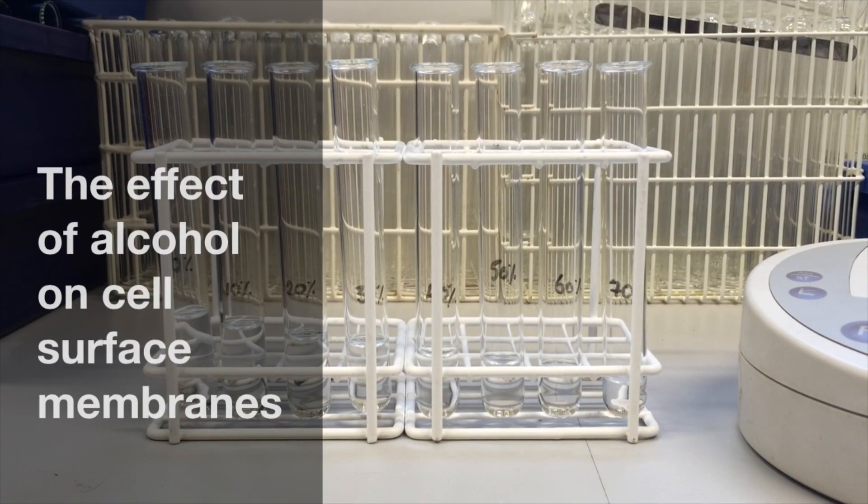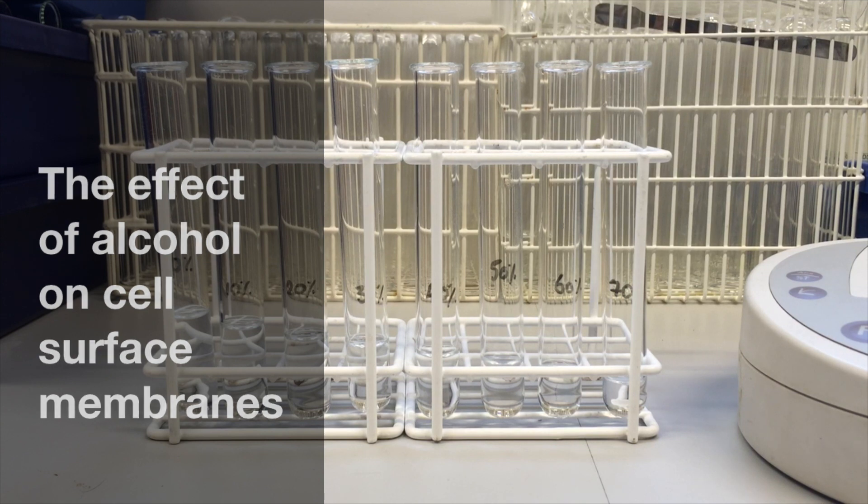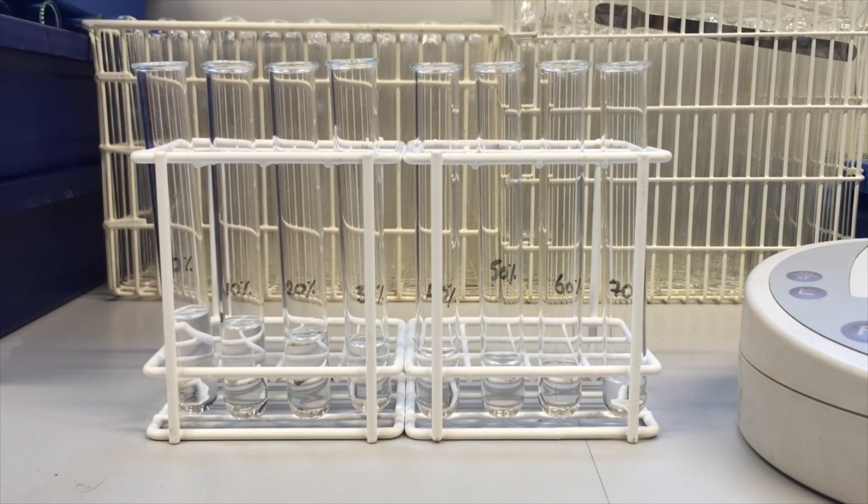Hello everyone. This video is going to be a practical investigation of the effect of varying concentrations of alcohol on the membrane integrity of beetroot cells. Okay, so let's begin.